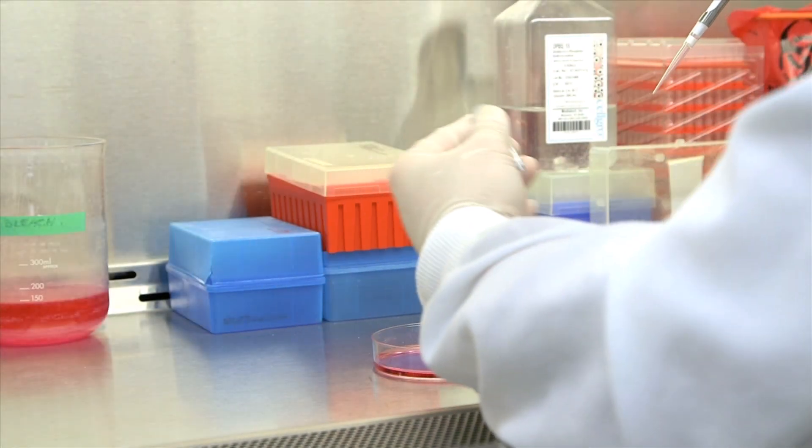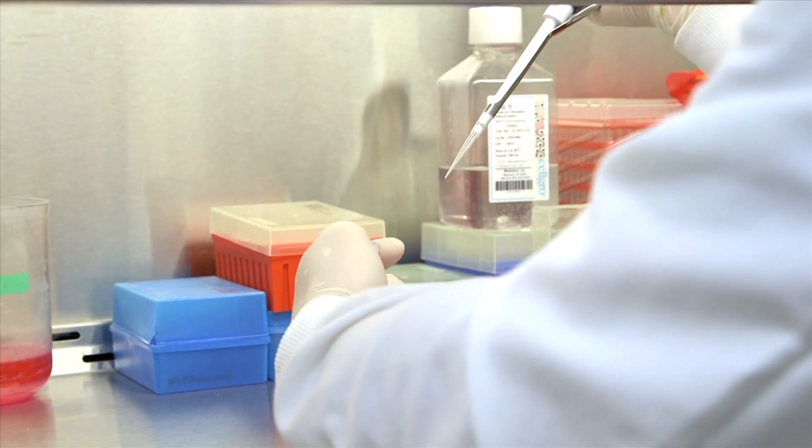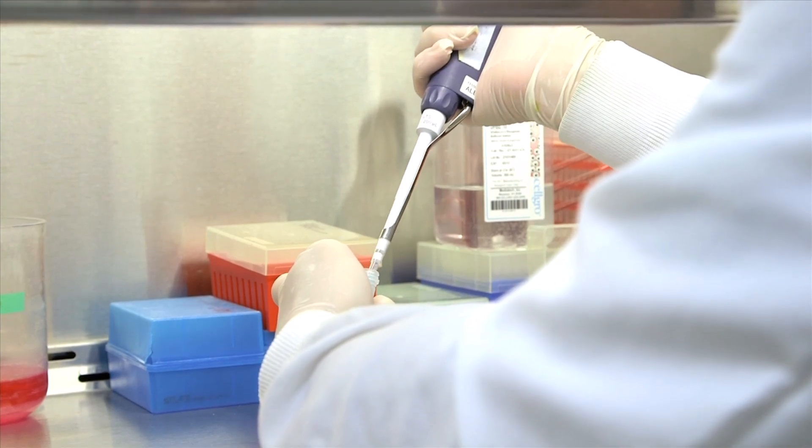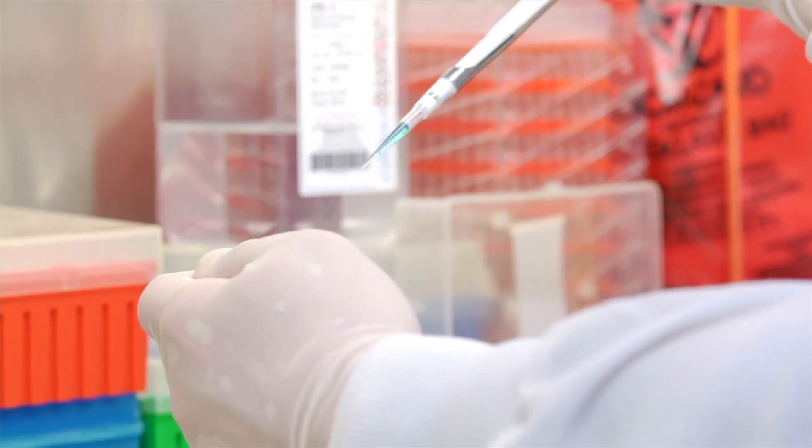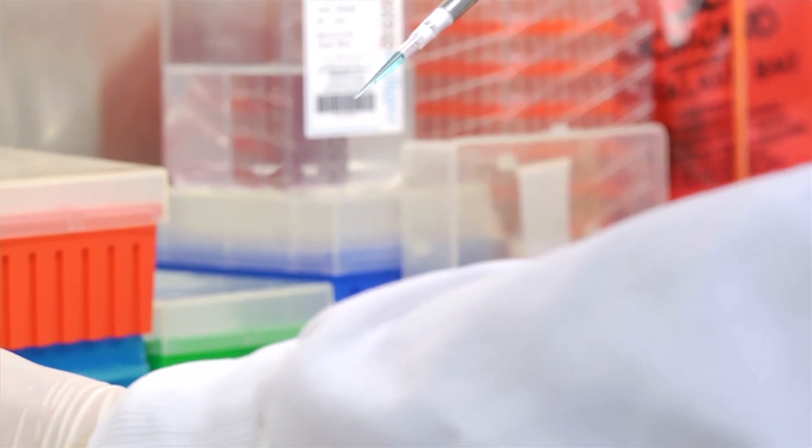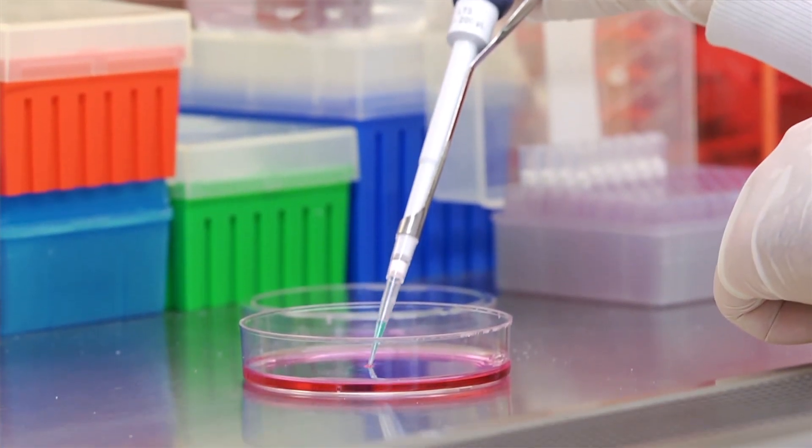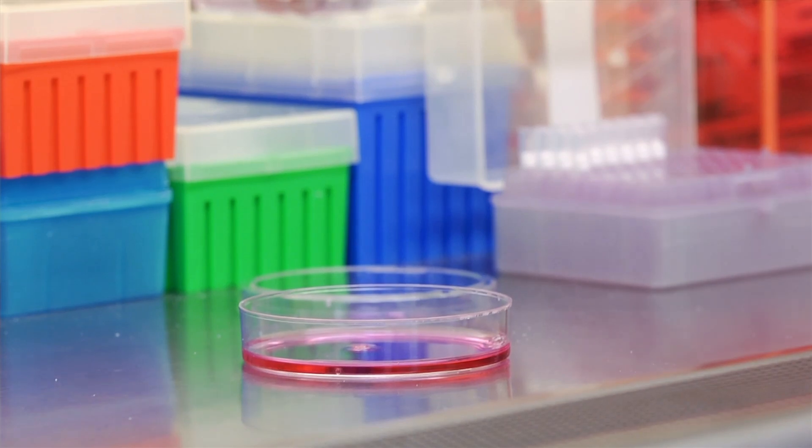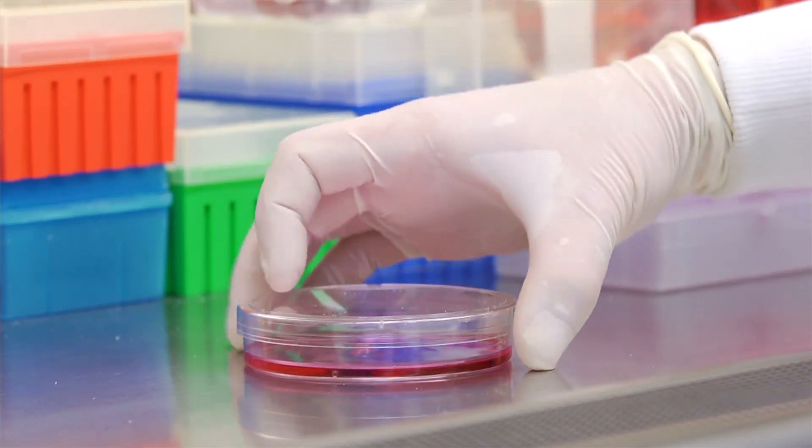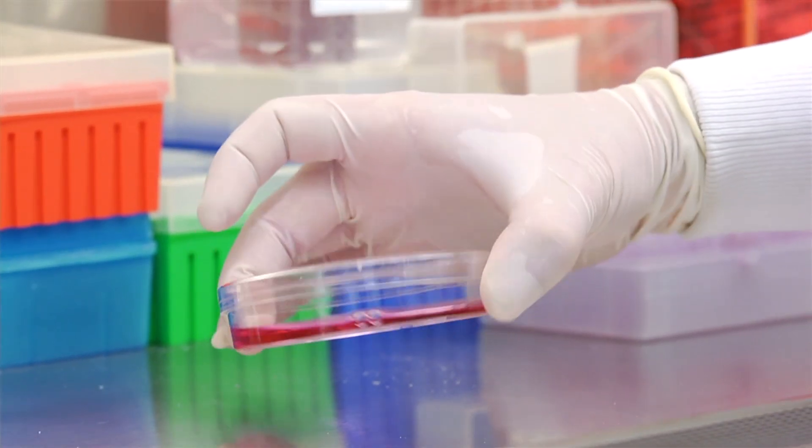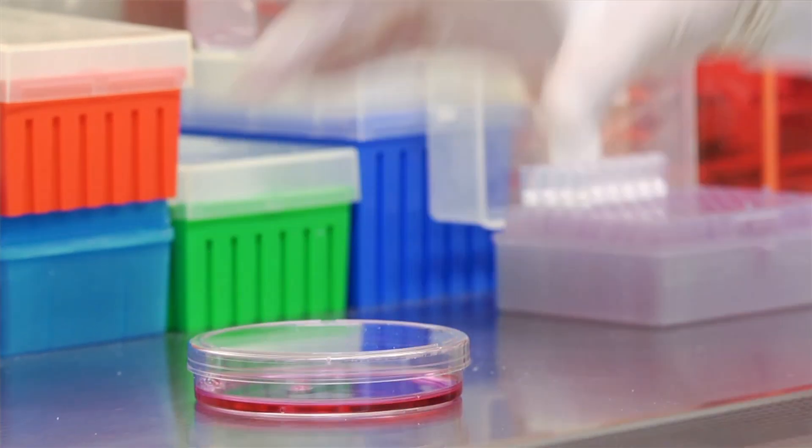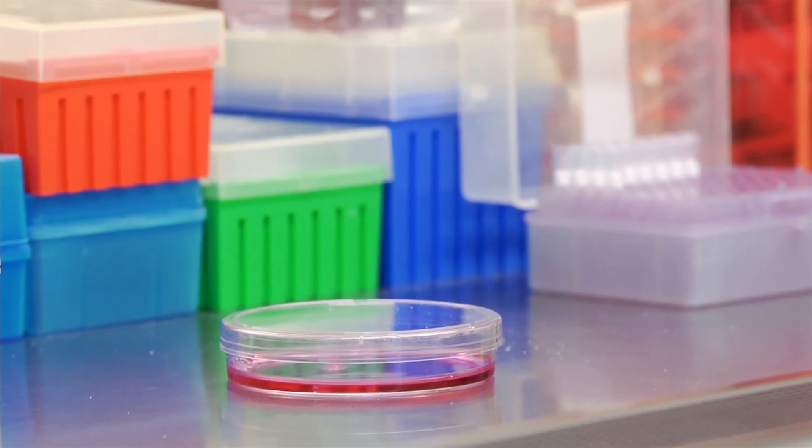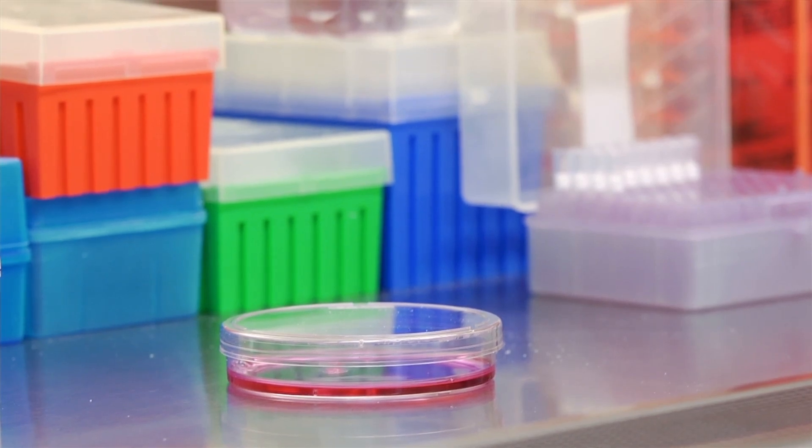Start with a tissue culture dish with cells. Let's say our 10 centimeter tissue culture dish contains a monolayer of 4T1 tumor cells. Reconstitute the probe according to the recommendations in the datasheet. Add the reconstituted agent to the tissue culture plate, so the final effective concentration in the cell media follows the recommended guidelines. Gently swirl the plate to mix the agent with the media and place the plate in an incubator at 37 degrees Celsius for the recommended incubation time. These times often vary but in our case we incubate overnight.